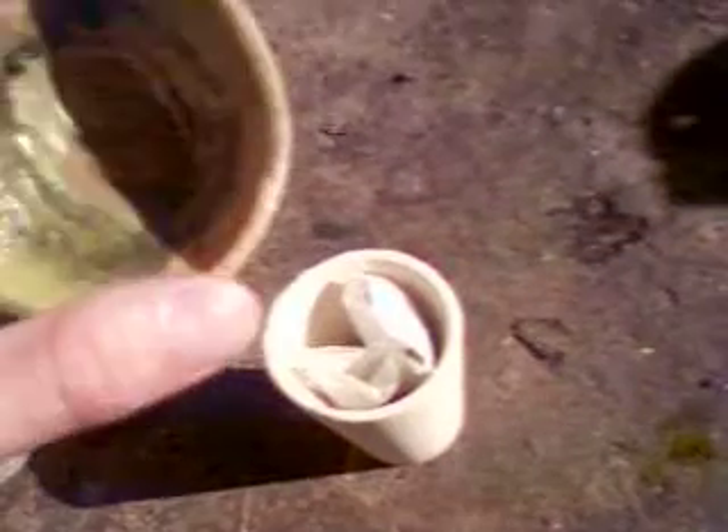I will take that prill and put it in a scorification dish. This dish right here is one that I used, and it is all green because of the copper, of course. There is going to be a little bit of copper contamination in that. And since I am splitting the bead into two exact beads, instead of going through the acid-clorox method, I am just going to run it through a fire assay and clean it up the rest of the way. Then I am going to split the bead into two exact weights and cupel each weight off and come up with two beads of exactly the same weight.